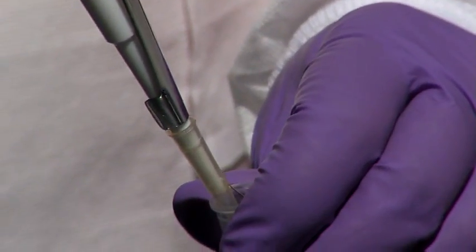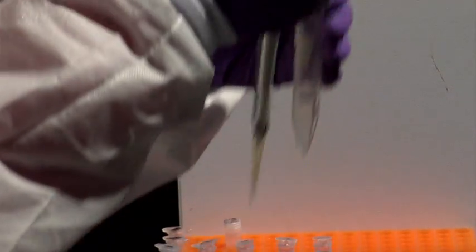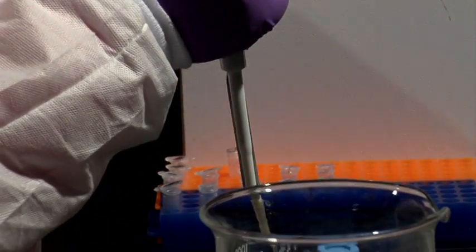Add 10 microliters of each fraction to the corresponding micro test tube. Do not add a fraction sample to the control tube.